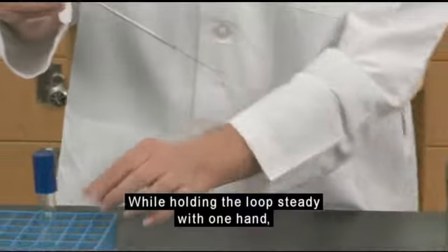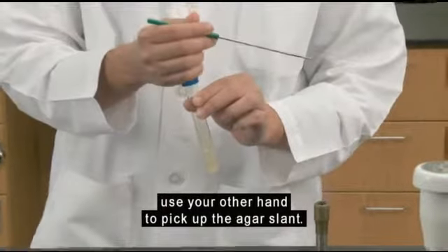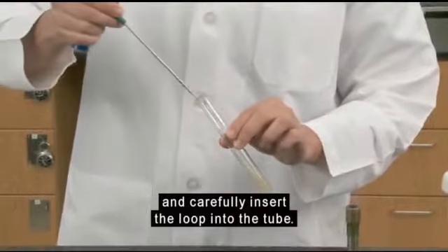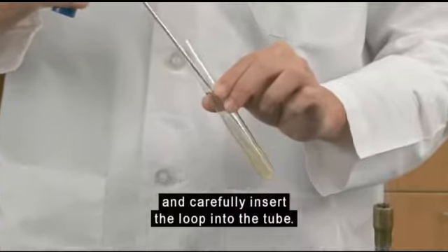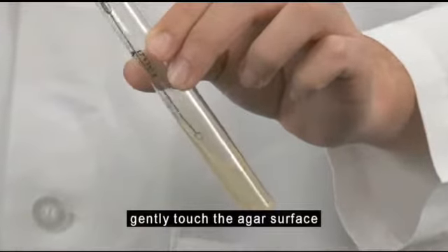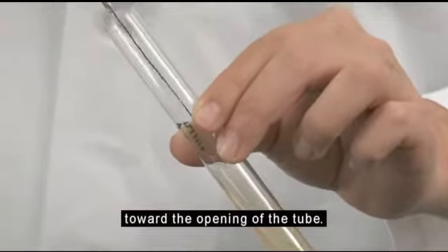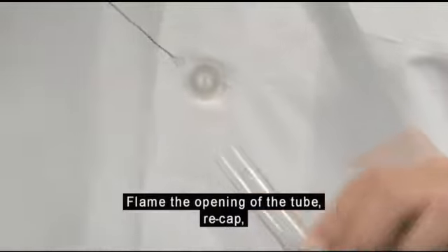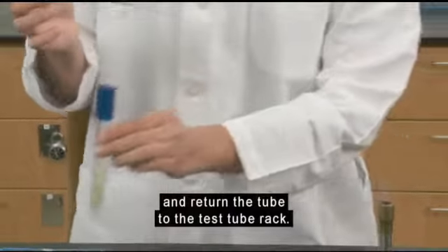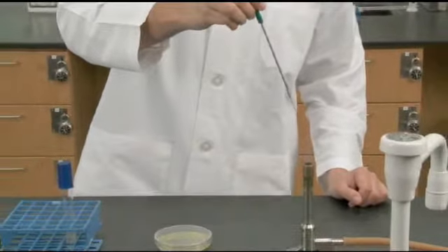While holding the loop steady with one hand, use your other hand to pick up the agar slant. Remove the cap, flame the mouth of the tube, and carefully insert the loop into the tube. Holding the loop parallel to the agar, gently touch the agar surface and zigzag the loop along the surface toward the opening of the tube. Flame the opening of the tube, recap, and return the tube to the test tube rack. Flame the loop to destroy any remaining bacteria.